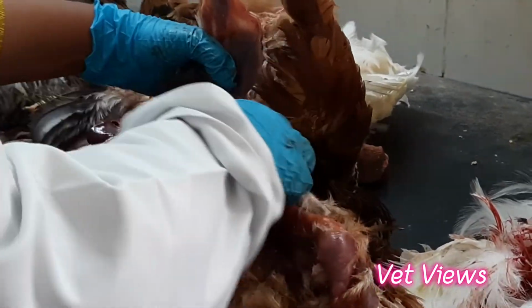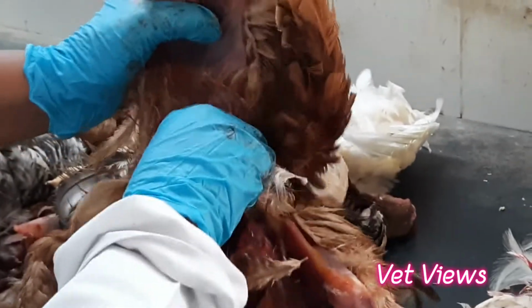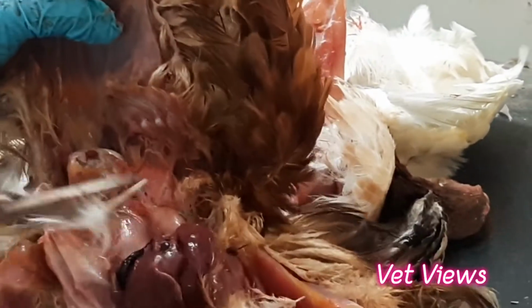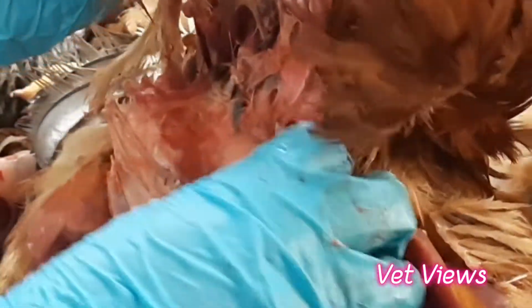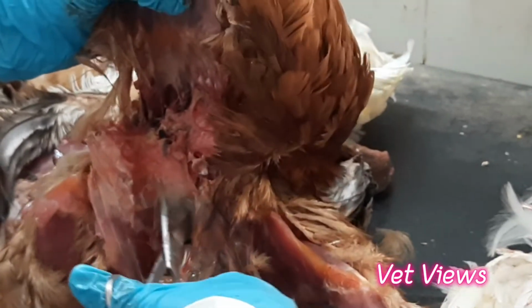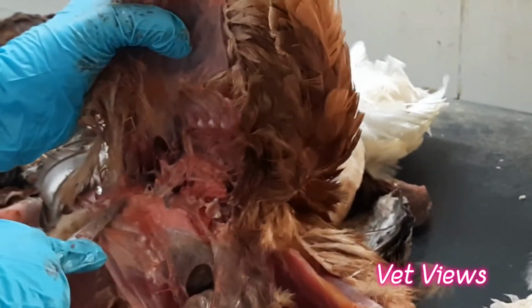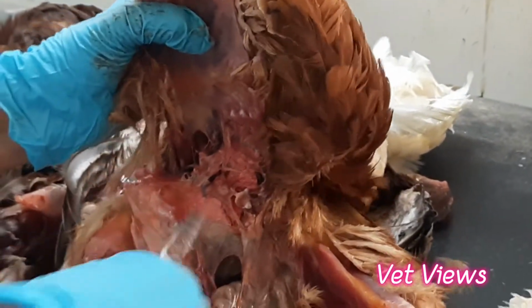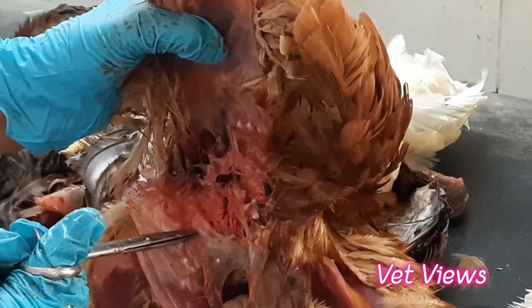So this is the heart. Here this case also has gout. And see the lungs. Lung color should be pale pink. Generally it doesn't expand like in other animals. It gets fixed in the bony part. Only the air exchange happens through the air sacs. So here it is very clear. This is the normal lung. In any respiratory infections, the lung becomes very congested. Severe congestion, so it becomes very reddish and thickened. So this is a normal lung consistency.